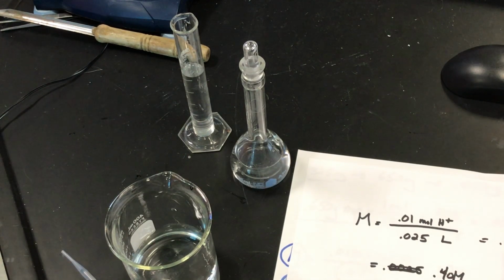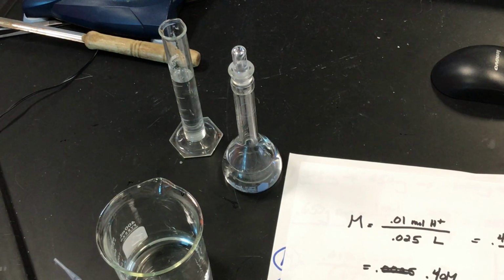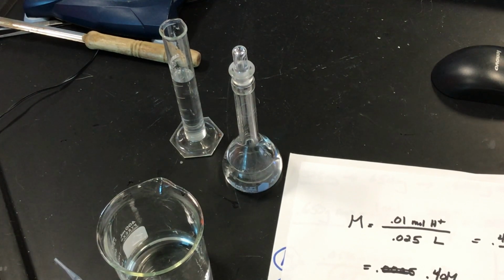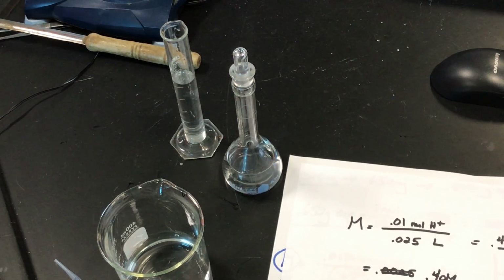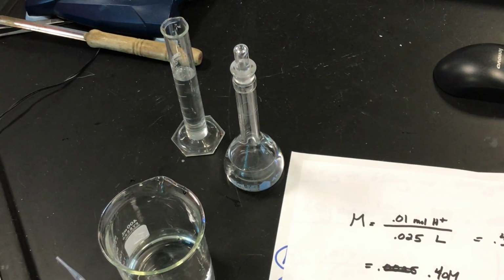Now, we probably should make more. This is where I just made a mistake, but we should probably make another one because we're going to titrate.